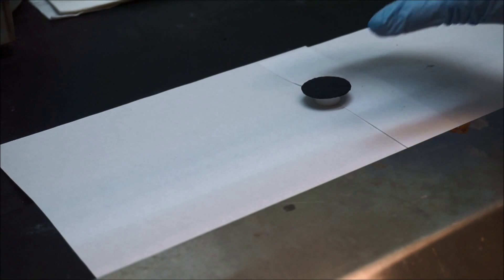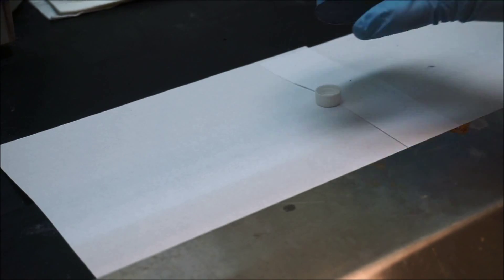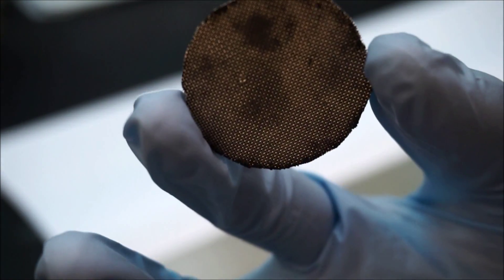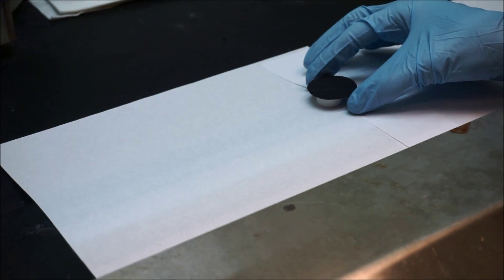After 8 hours, the cathode is already dry and we can use it in our MFCs. Remember to put the stainless steel side towards your solution. Thanks for your watching.